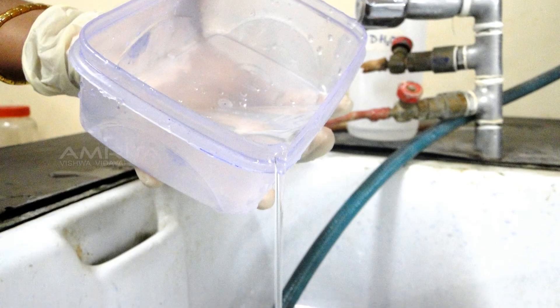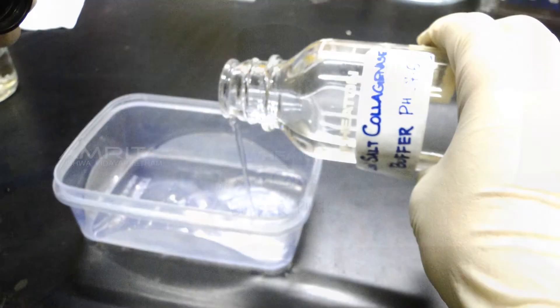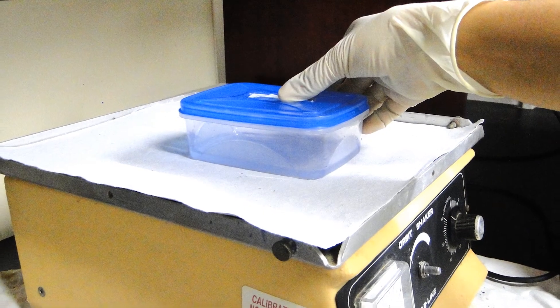Discard the Triton X-100 solution and add low salt collagenase buffer into the gel and leave overnight on an orbit shaker or minimum for 4 hours.